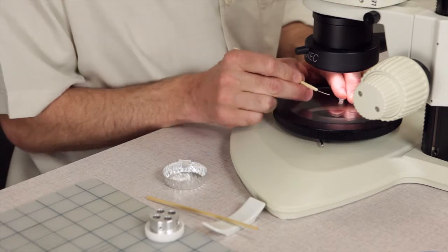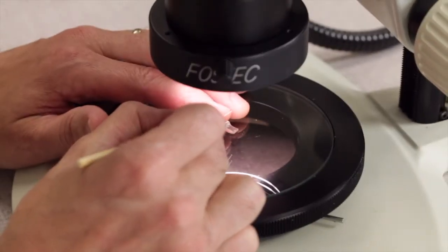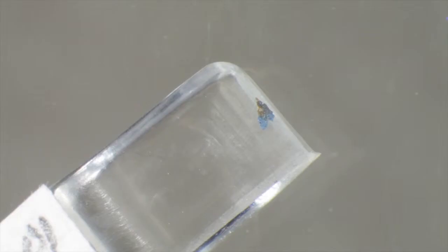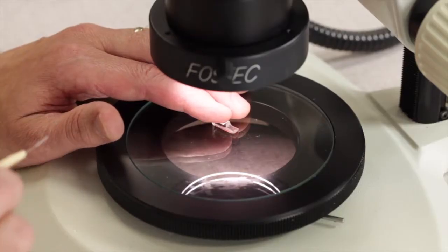I've already pre-positioned the sample up at the tip and I'm going to sneak up to it. I've got a little droplet of the cyanoacrylate which will wick in with good luck.